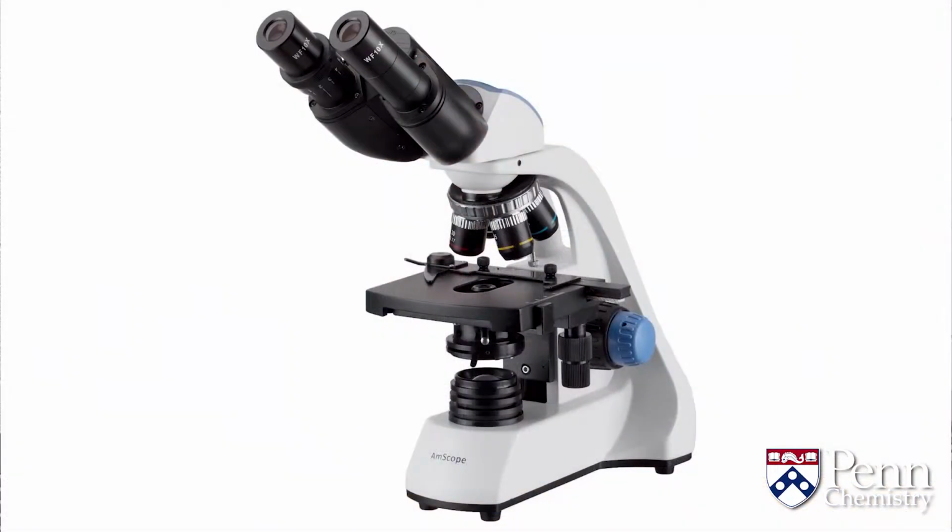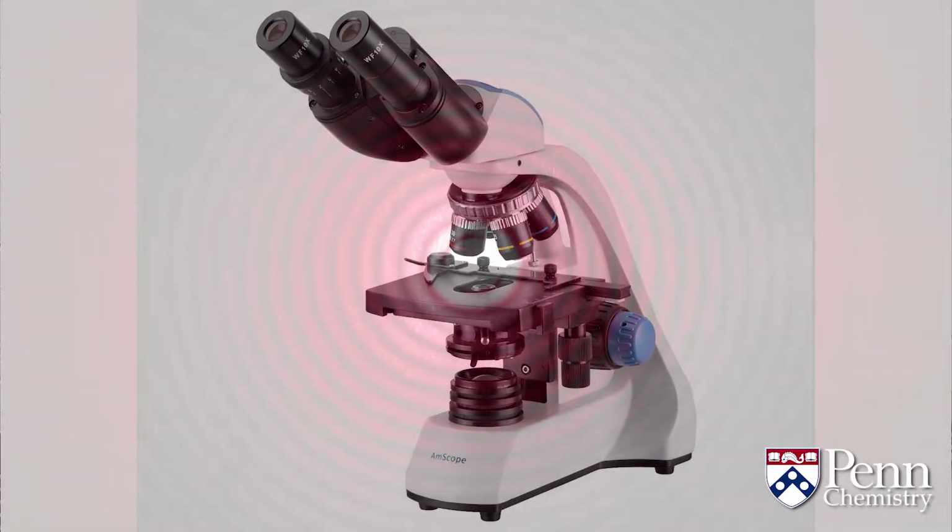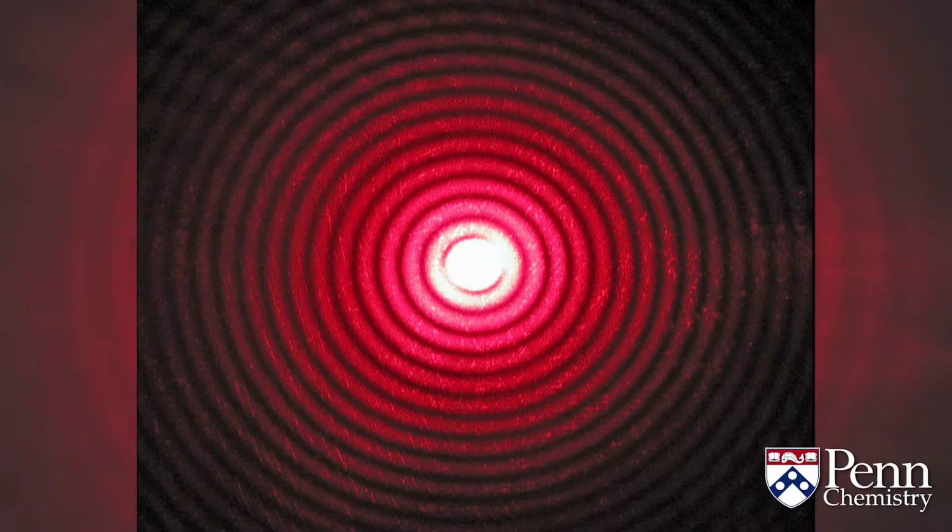If I were to give an analogy to explain a little bit about the theory behind X-ray crystallography, I might compare it to an optical microscope. An optical microscope uses visible light. It has one lens that looks at the object and constructs what's called a diffraction pattern. Then the second lens takes that diffraction pattern and reconstructs it to form the enlarged image. We would like to do the same sort of thing.